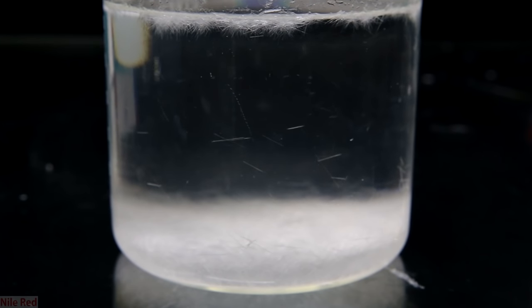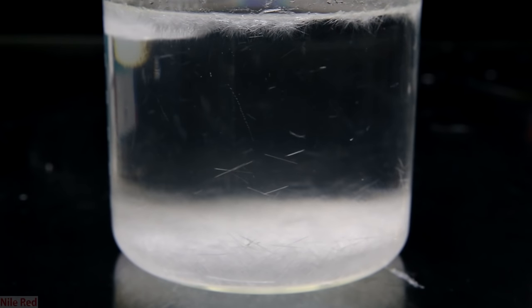Crystals will also form at the top of the liquid because it's losing heat to the air and cooling down faster than the rest of the liquid. I think it's pretty cool and mesmerizing to watch the crystals floating around in the solution.